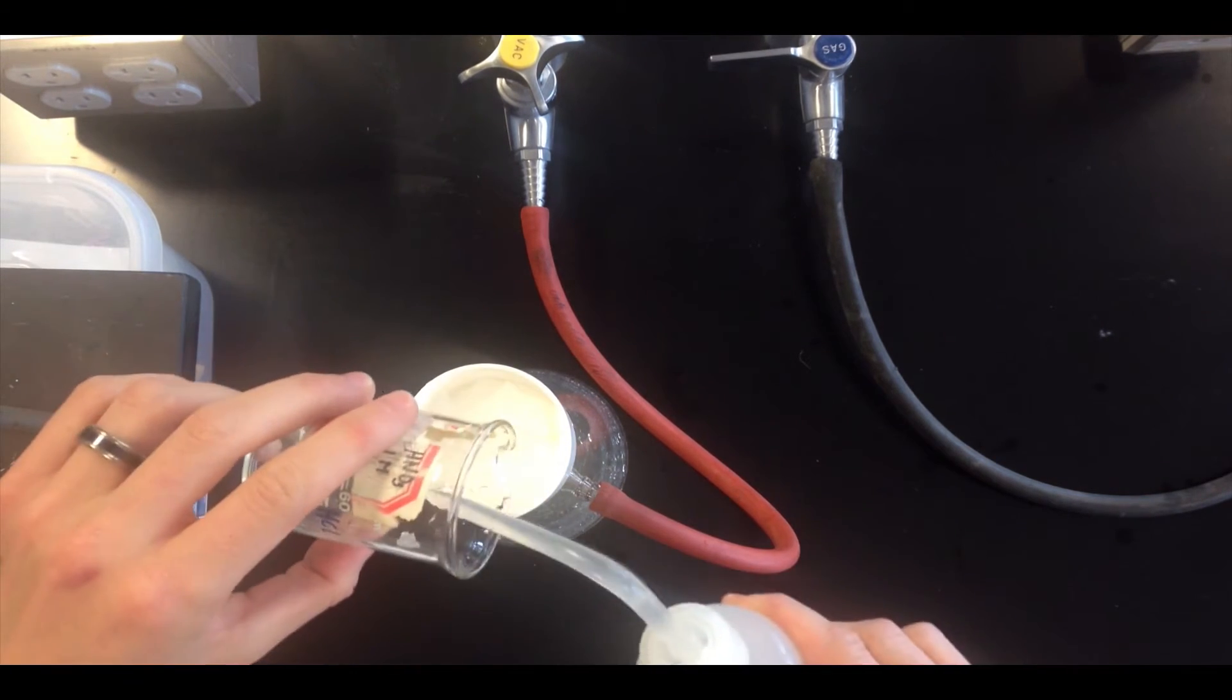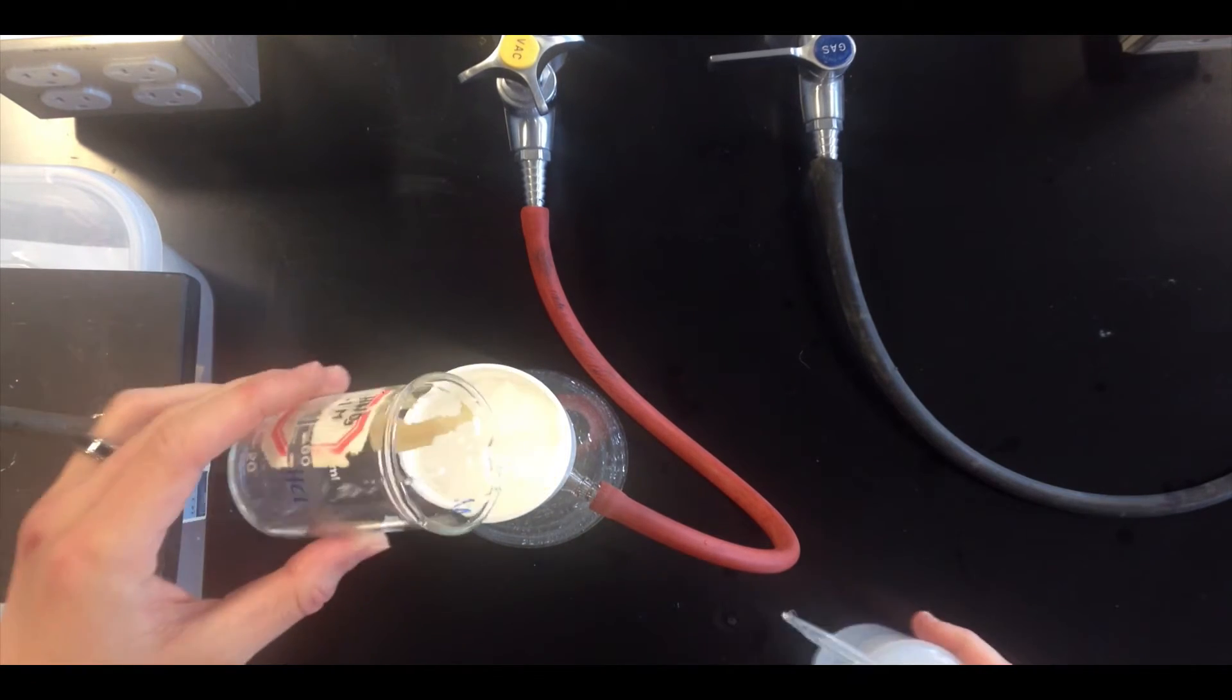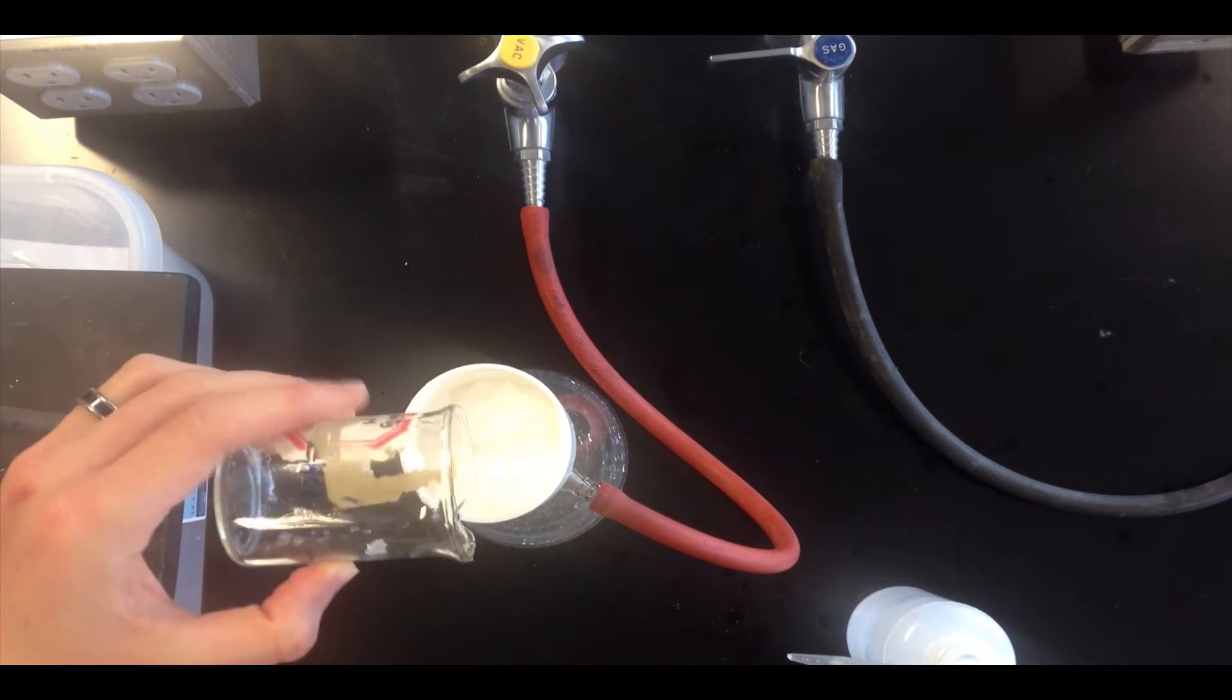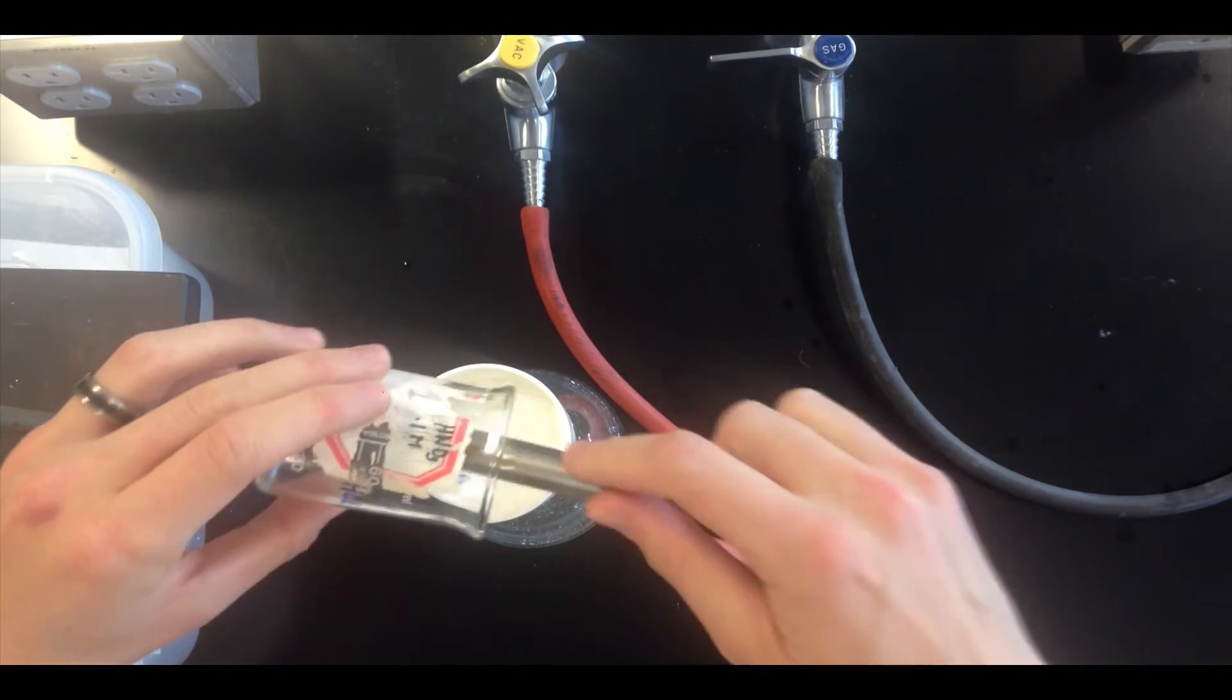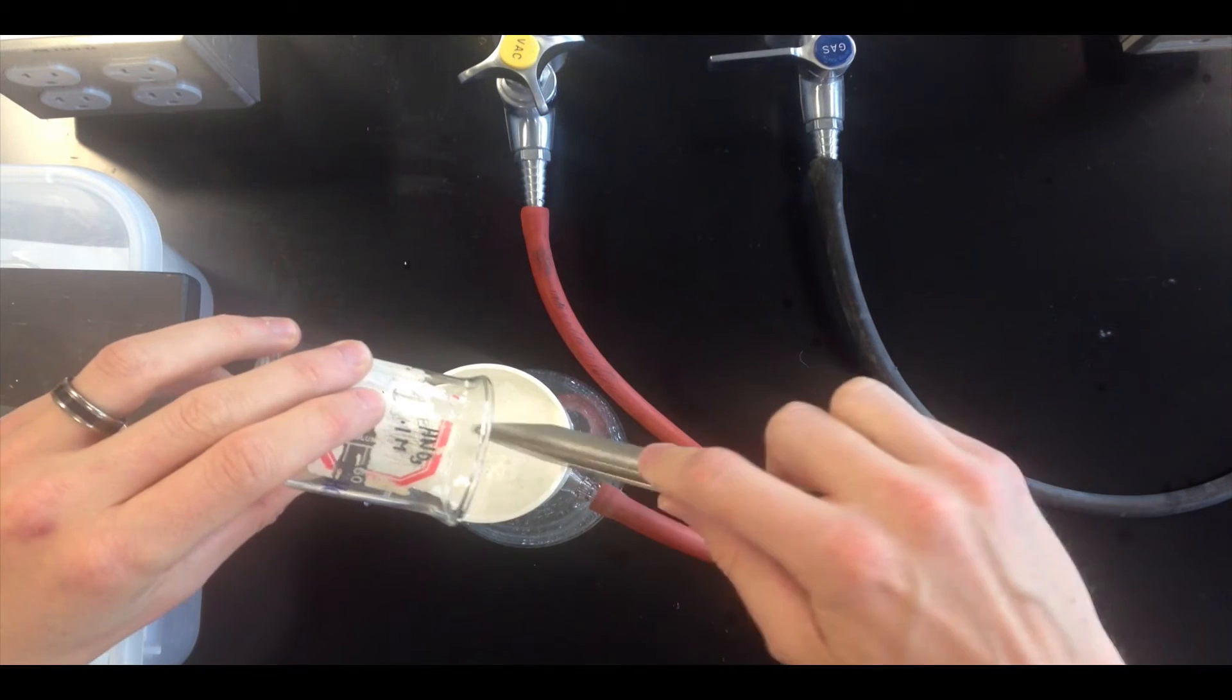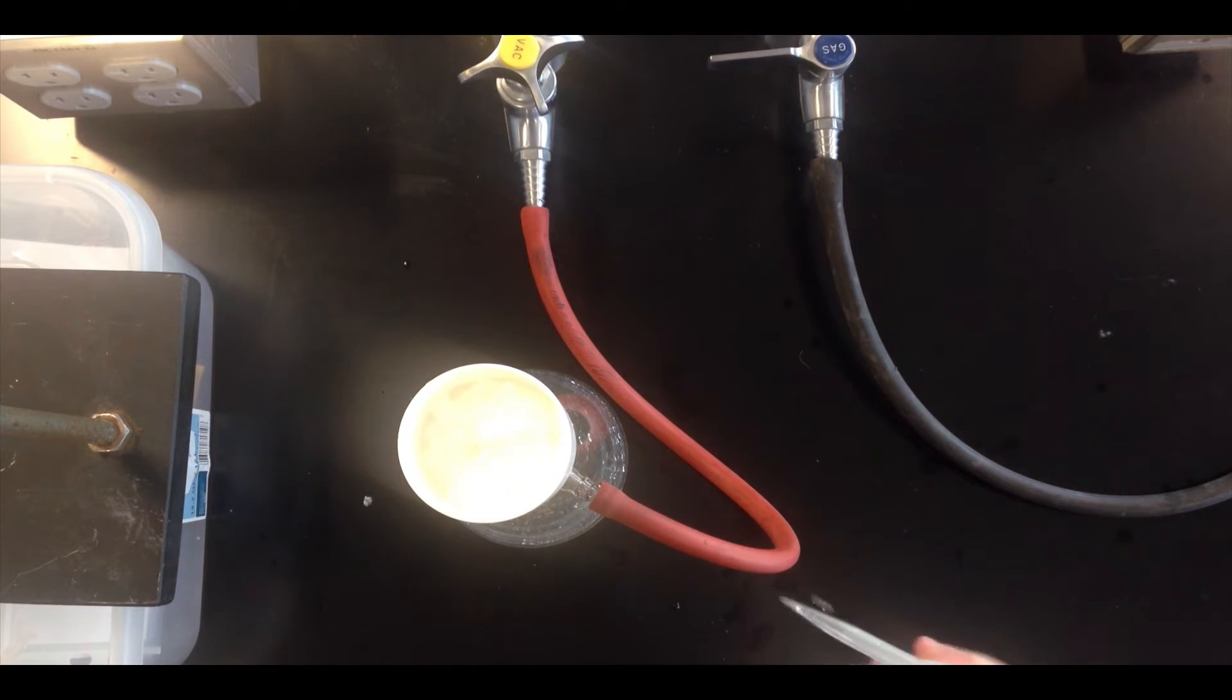This will help wash out that last little bit of solid in the bottom of the beaker, and especially when you have much finer solid in there, something like a powder rather than crystals, that's going to be essential to getting high yield. So pour your washings into the beaker first, and then go over top.